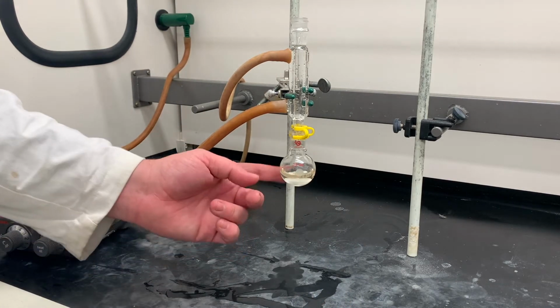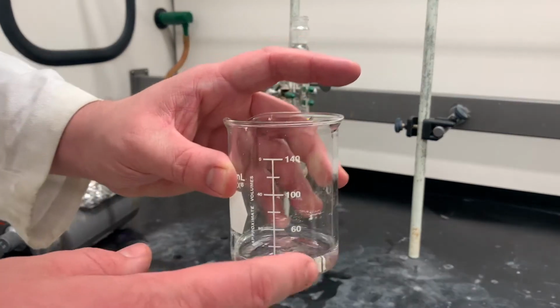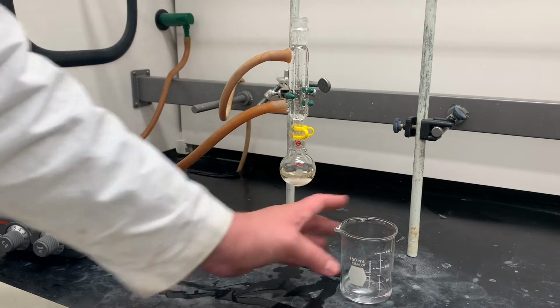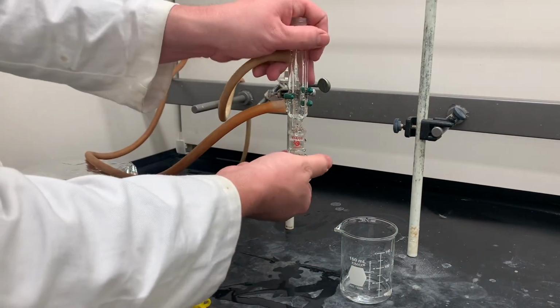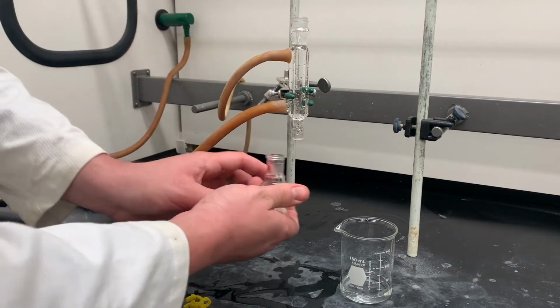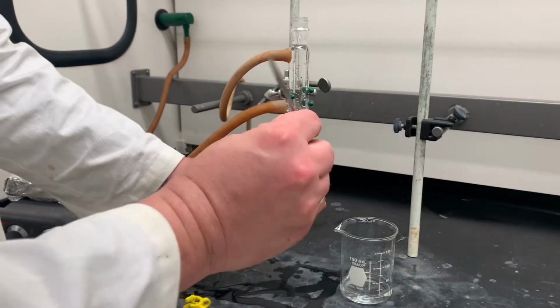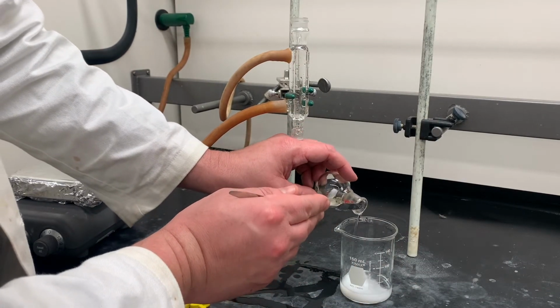Now, if you have a 50 ml flask, this is big enough, you can add the 20 mLs of DI water straight to that. However, I'm gonna do it in a beaker because I have a small flask here. Also, it becomes easier to deal with the recrystallization. Also, I'm gonna take my spatula here, just to prevent the stir bar from coming out.